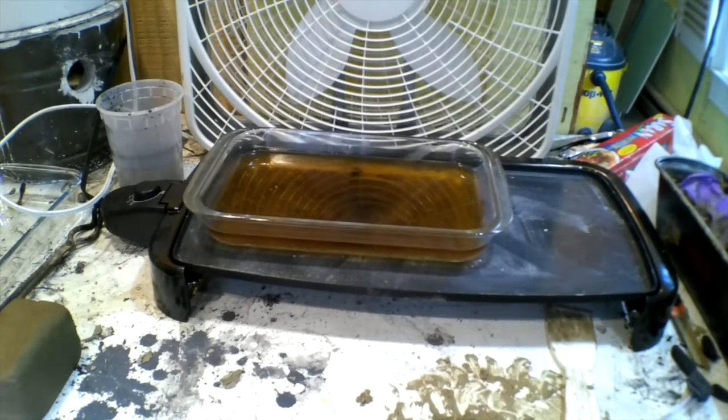That right there is my second batch of potash. This stuff is not charcoal ash. You remember the color of that stuff I got out of the charcoal ash — it was almost like a bright green pea. This is from yard trash, essentially weeds that I pulled up and let dry and then cooked. They're supposed to be higher in potassium carbonates, so I actually did that on purpose.